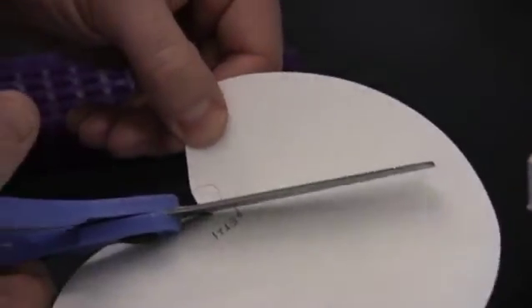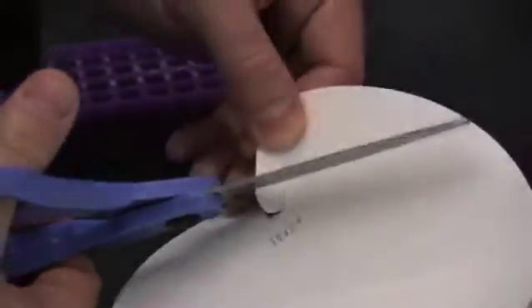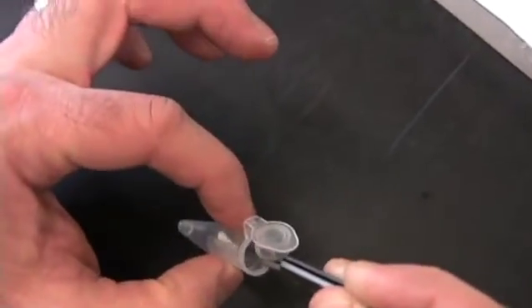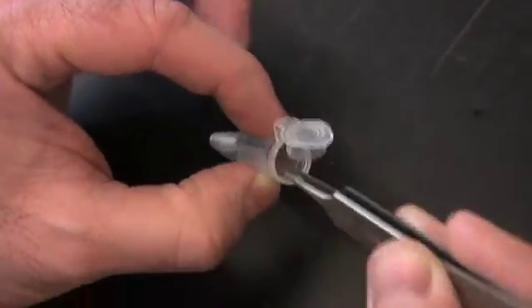Use a clean pair of scissors to cut out the circle you drew earlier. Then place the filter paper in an epi tube with 20 to 40 microliters of water.